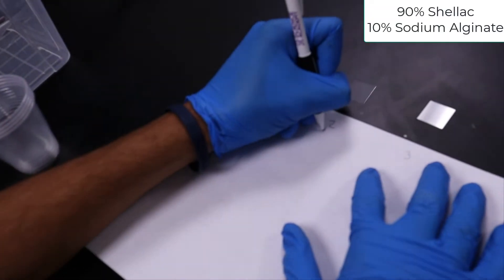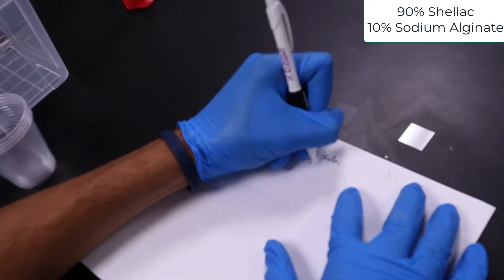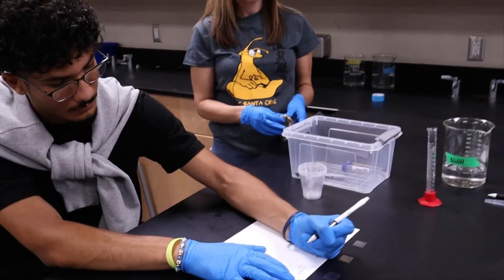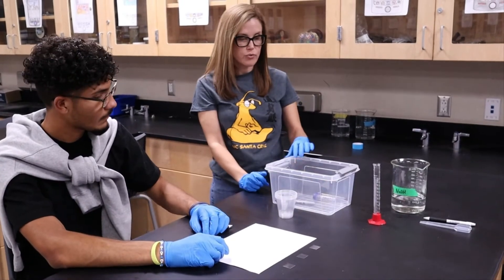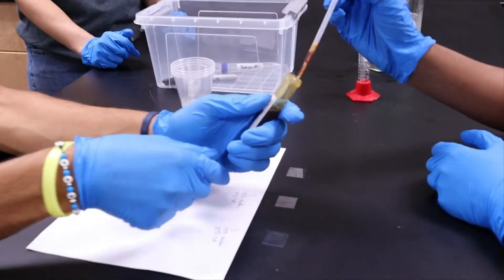For ratio number two, we're going to try out 90% shellac and 10% sodium alginate. For ratio number three, we're going to try out 70% shellac and 30% sodium alginate. Remember, your total should equal 100%. These correspond to the number of drops you're going to put on the slide — we'll always start with shellac. On the first cover slip, you're going to do two drops of shellac right in the middle.